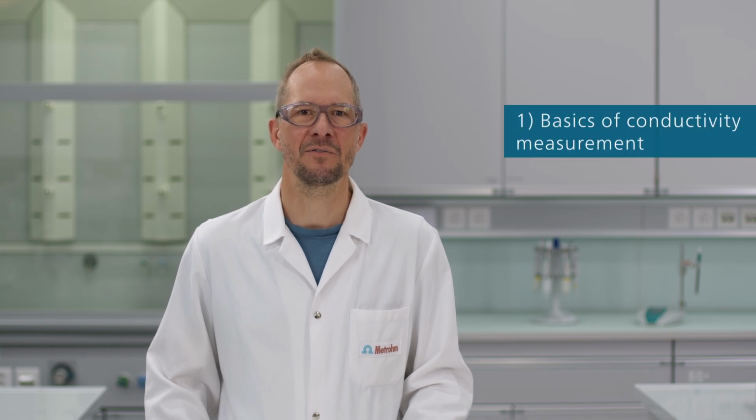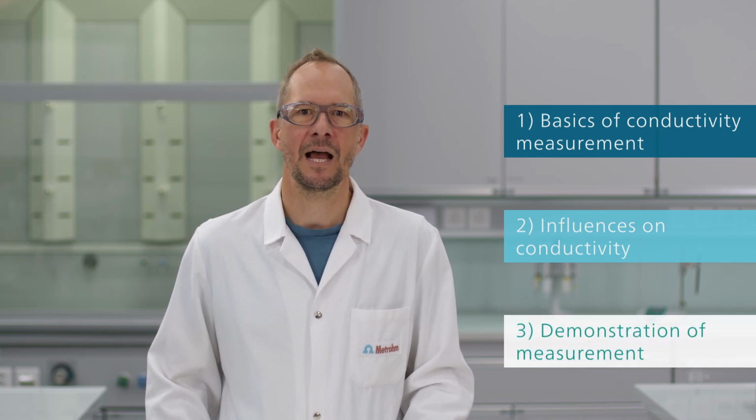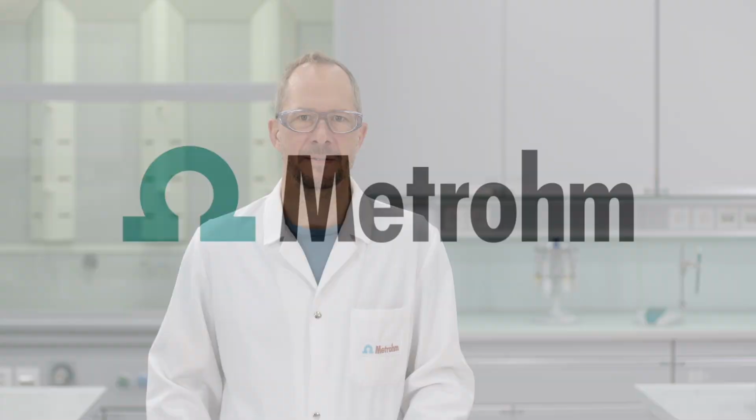Hello, I'm Simon. In this video, we will dive into conductivity measurement. First, I'll cover the basics of how it works, then I will discuss the factors that influence its accuracy. Lastly, I'll show you how to make a measurement.